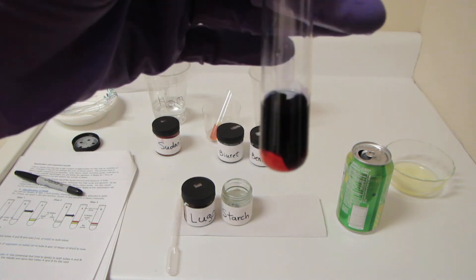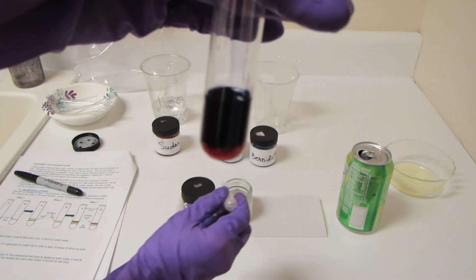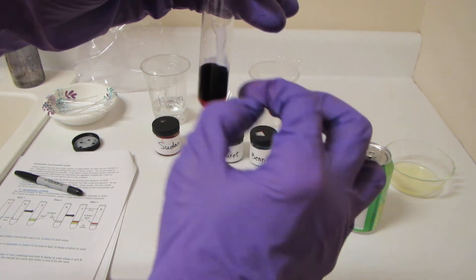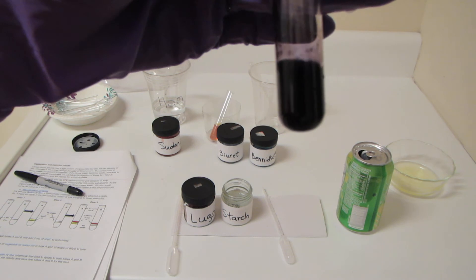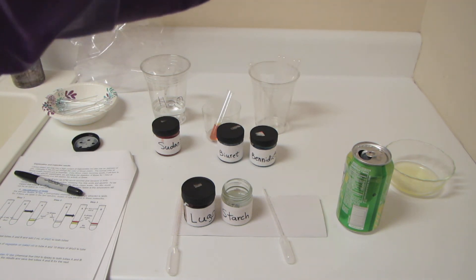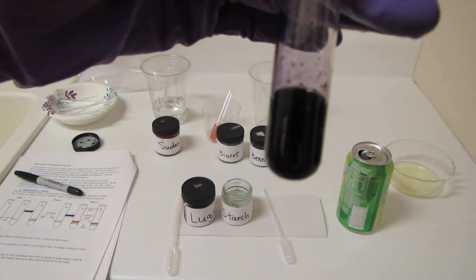Look what we got going on right there. Let me clink it for you guys. That's a pretty impressive reaction. It went from amber-brown to this beautiful jet black color.